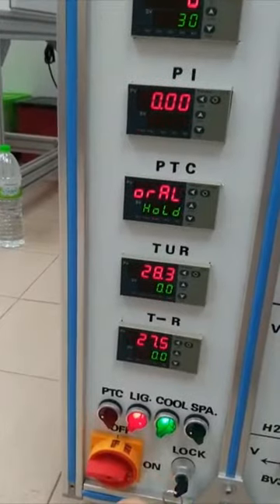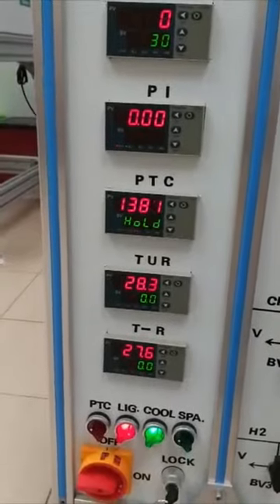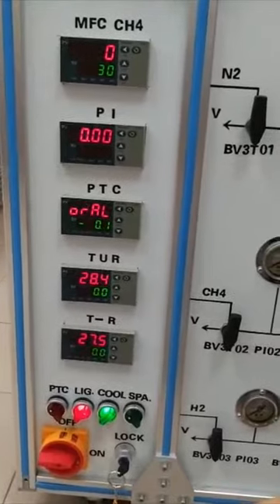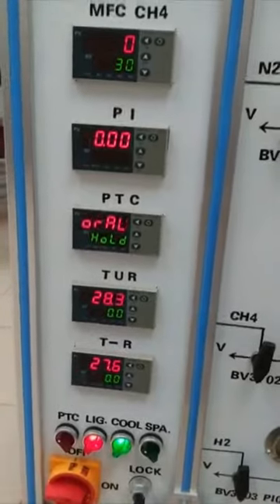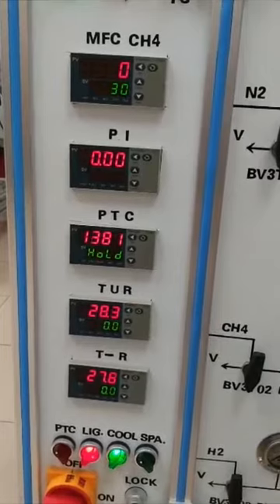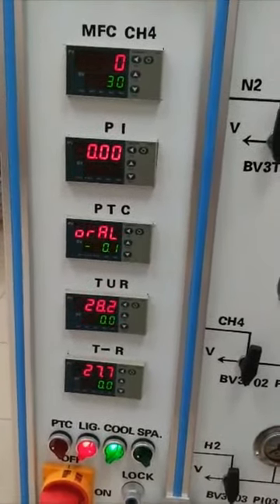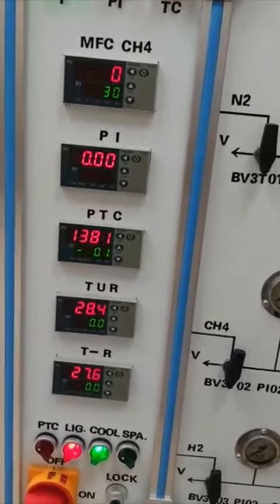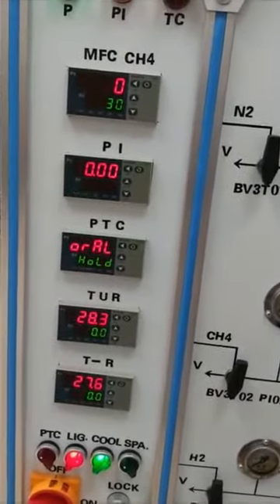But turning on the main valve only indicates the power is on; there will be no electric supply into the system, because another lock is installed to forbid strangers from using your system without permission. So if you want to use this system, you need to get the owner's permission and get the lock key to start the system.